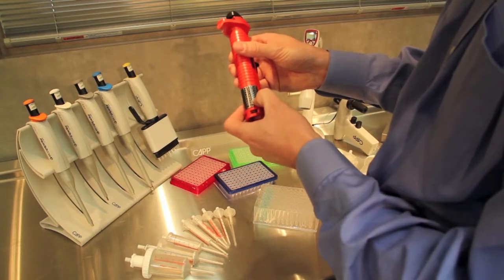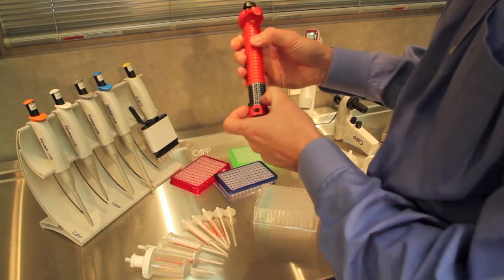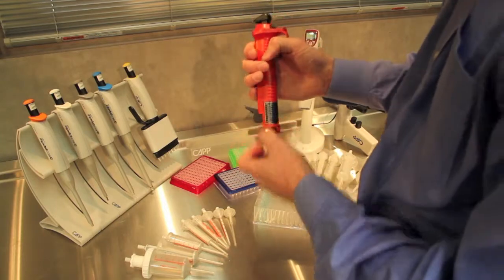So we are going to be dispensing one mil and we need at least eight dispenses, so we will use the twelve and a half mil syringe.